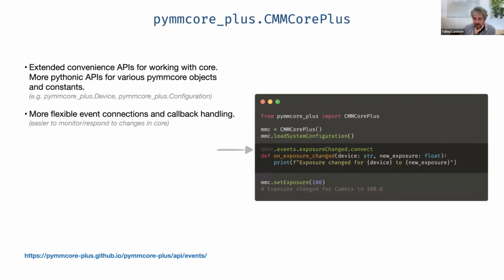So the core object gains this events object that has a number of things you can connect to. For instance, exposure change connect. So here is a function that whenever the exposure changes, we would like it to be called with the name of the device and the new exposure. So for instance, if you did that and then you ran mmc set exposure, this function would get called and it would print exposure changed for camera, that's the name of the device, to 100, the new exposure.